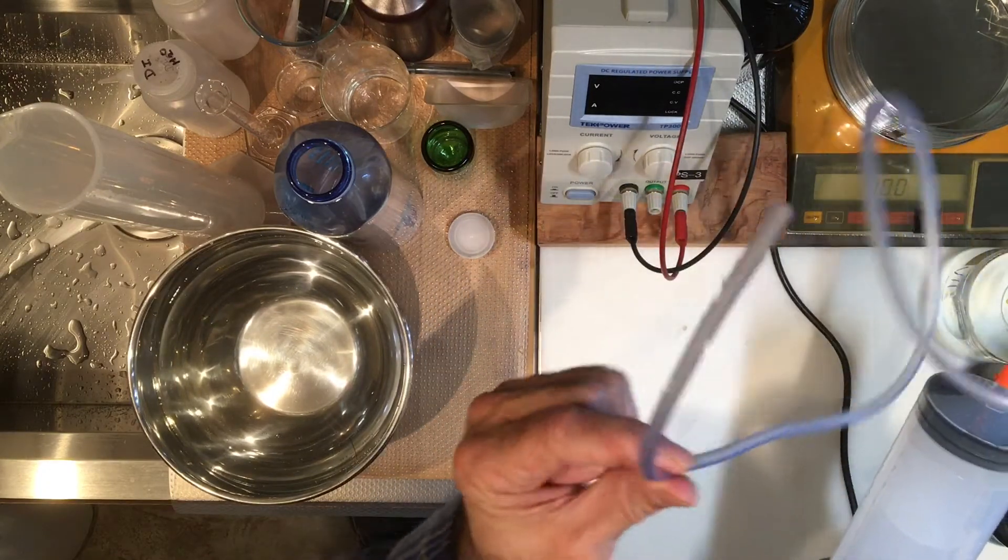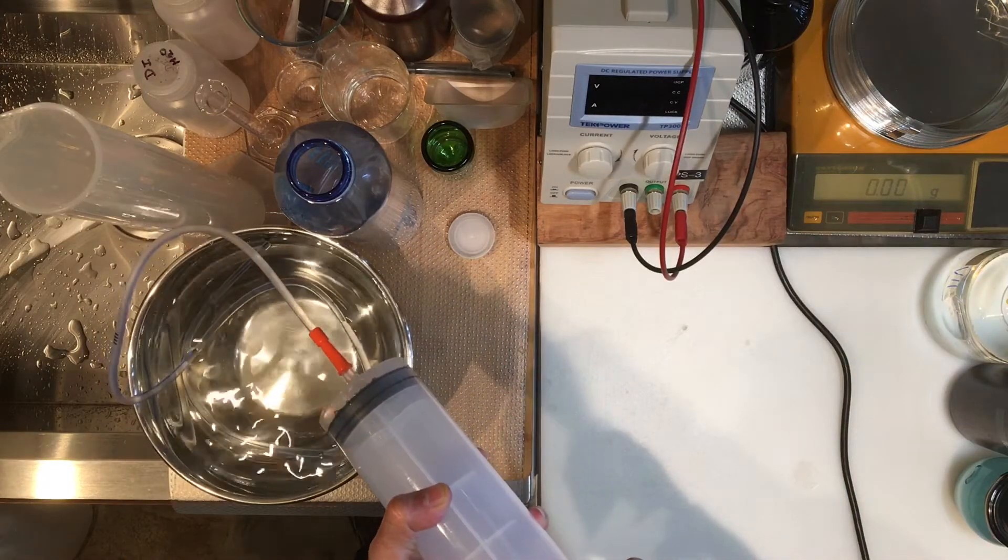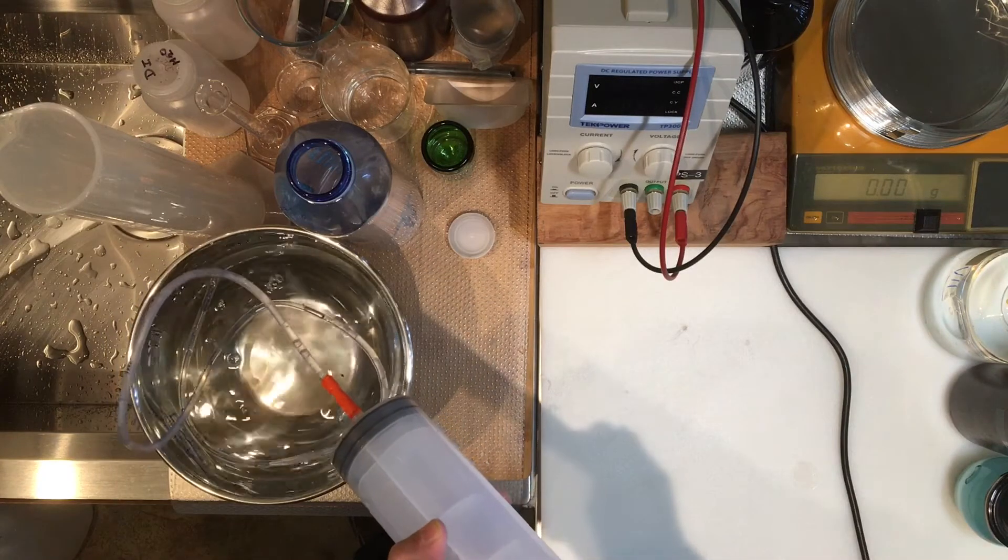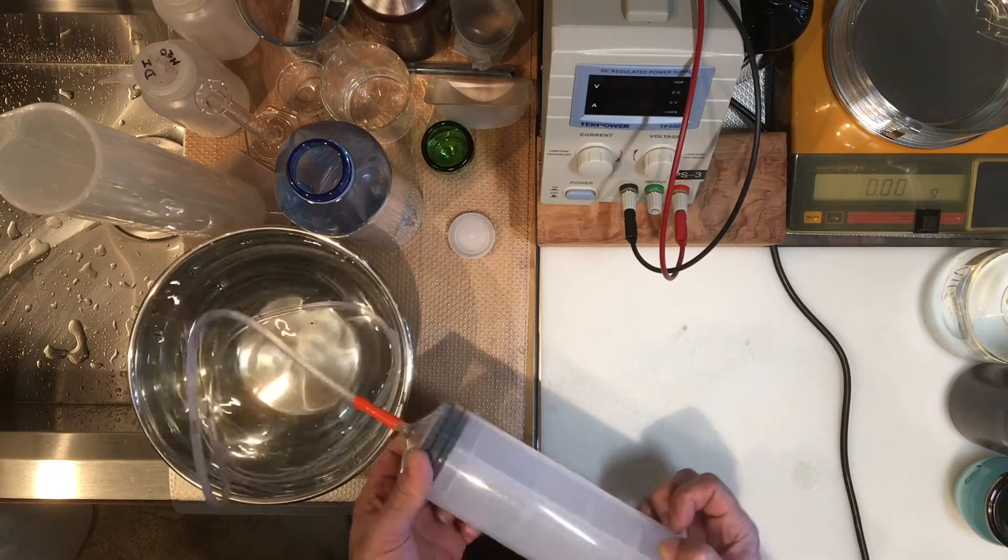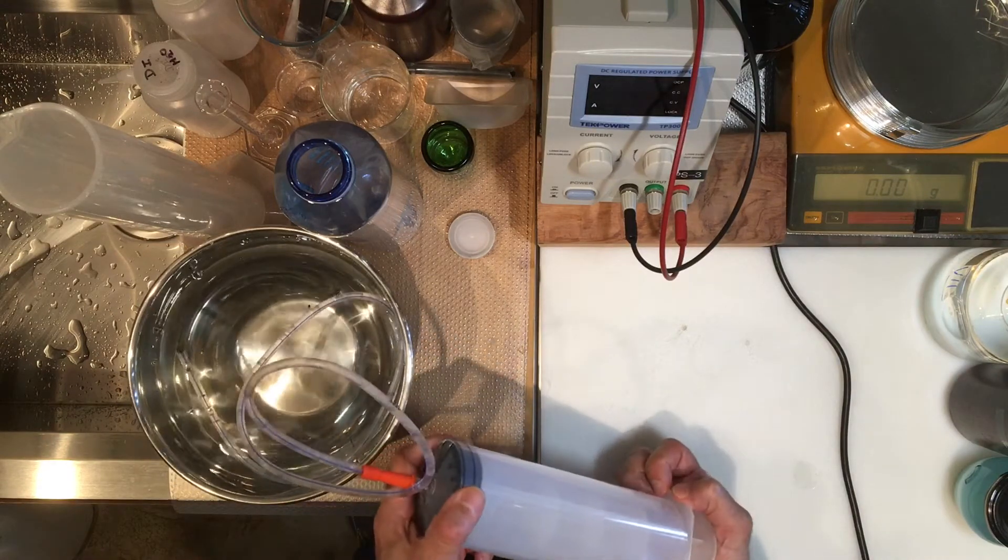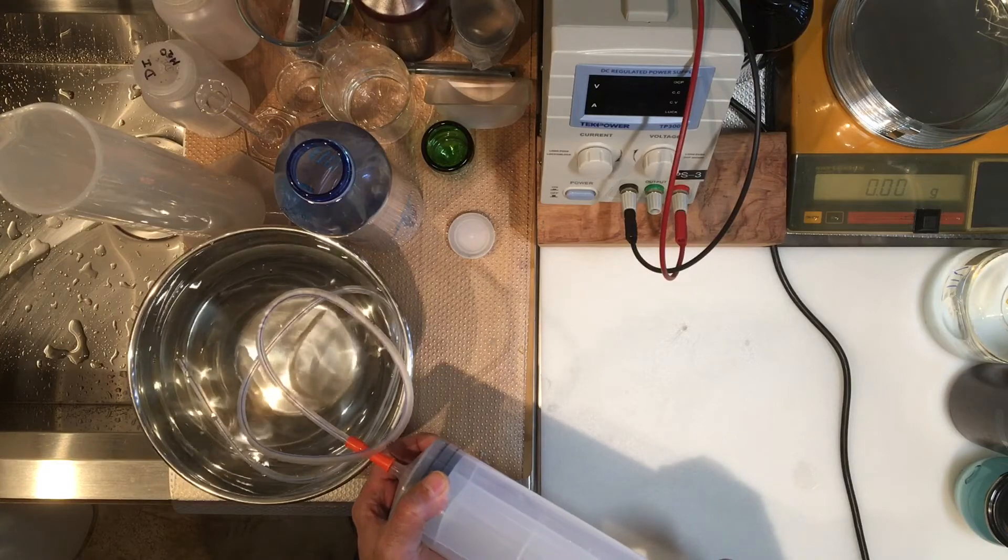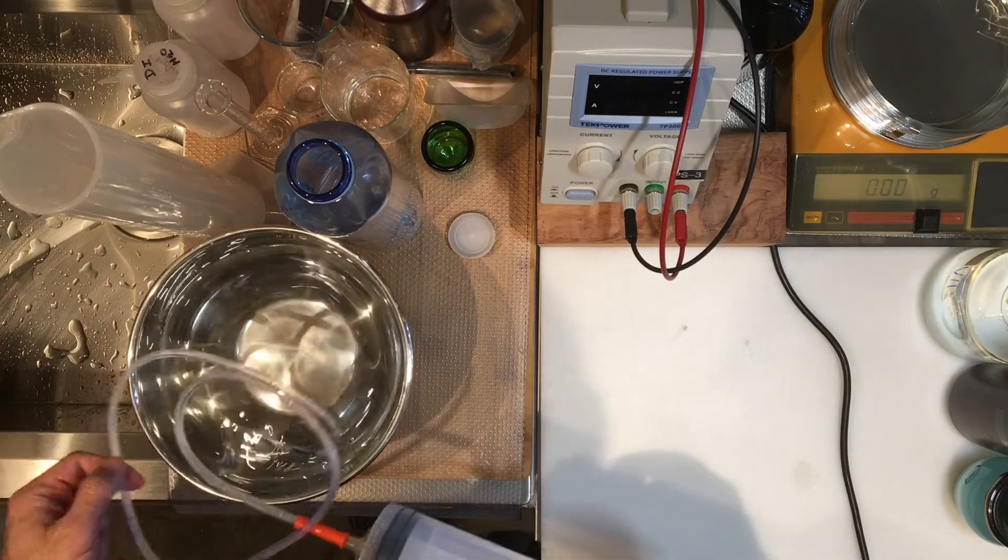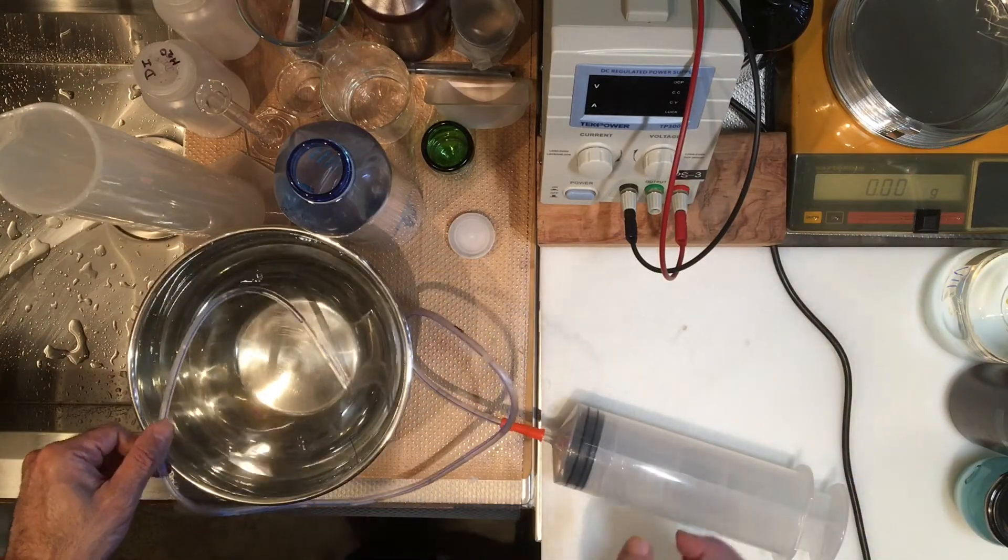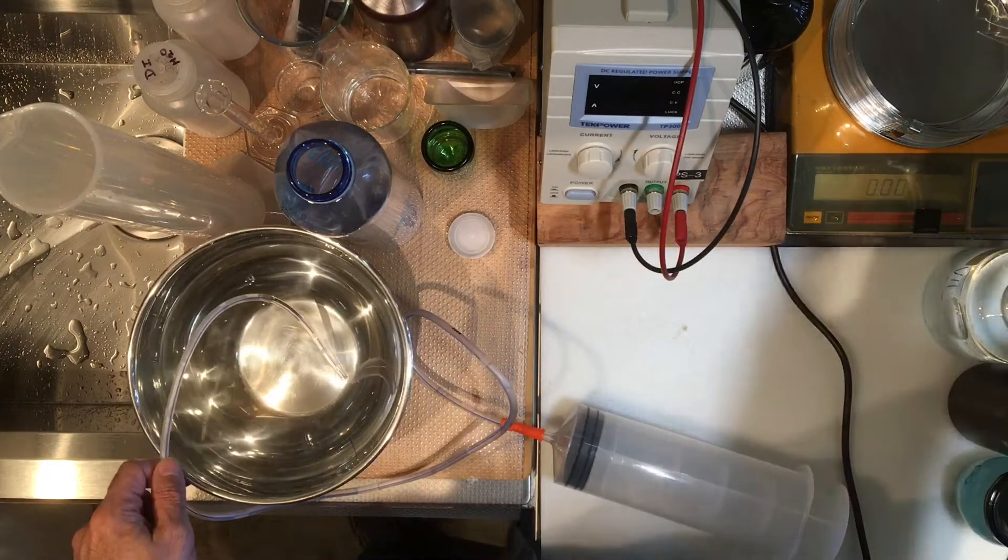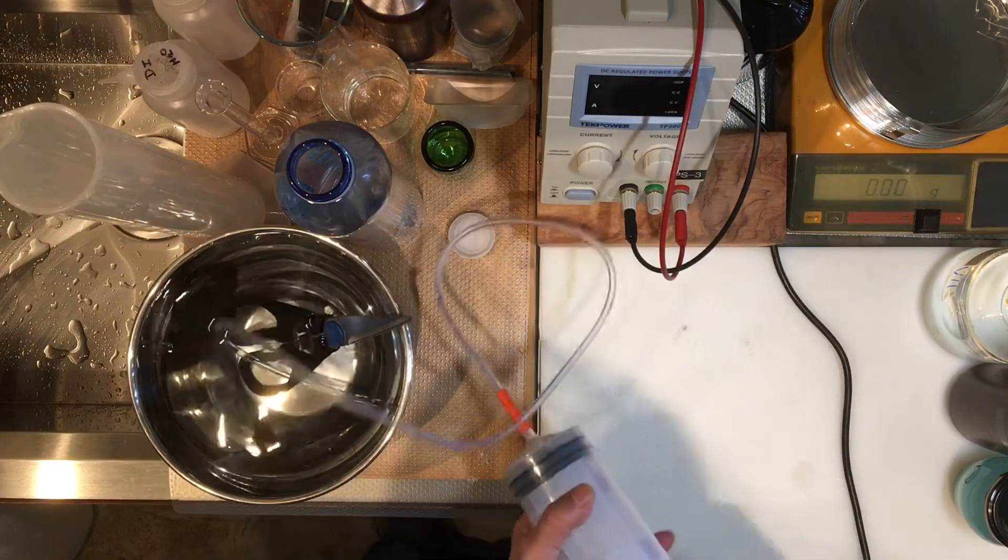I'm not going to use it for that purpose. I'm not trained for that and I have no need for it, so I'm just going to use it for the gas aspect. But I was surprised it came with this. Let's go ahead and do this. I want to make sure that this is totally filled with water. This tubing keeps coming to the surface and I need to weigh it down, so I'm just going to put the scissors on to the end of it. It has several holes in it.